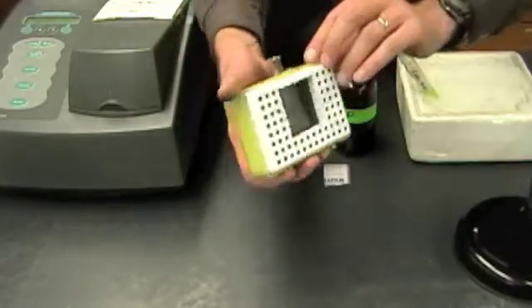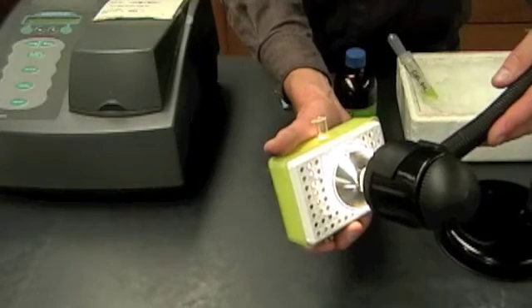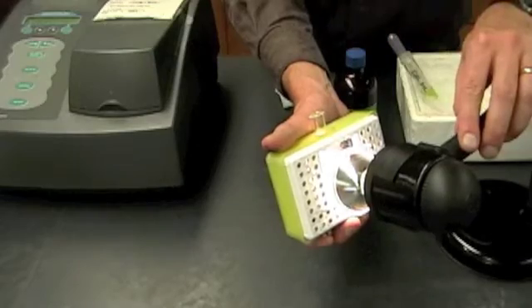You can see this tube fits inside this little cassette here. This is going to be important because when we're ready to go, I have my light bulb here and I'm going to hold this right up against it. This establishes the right distance between the tube and the light to give me the reaction that I need.